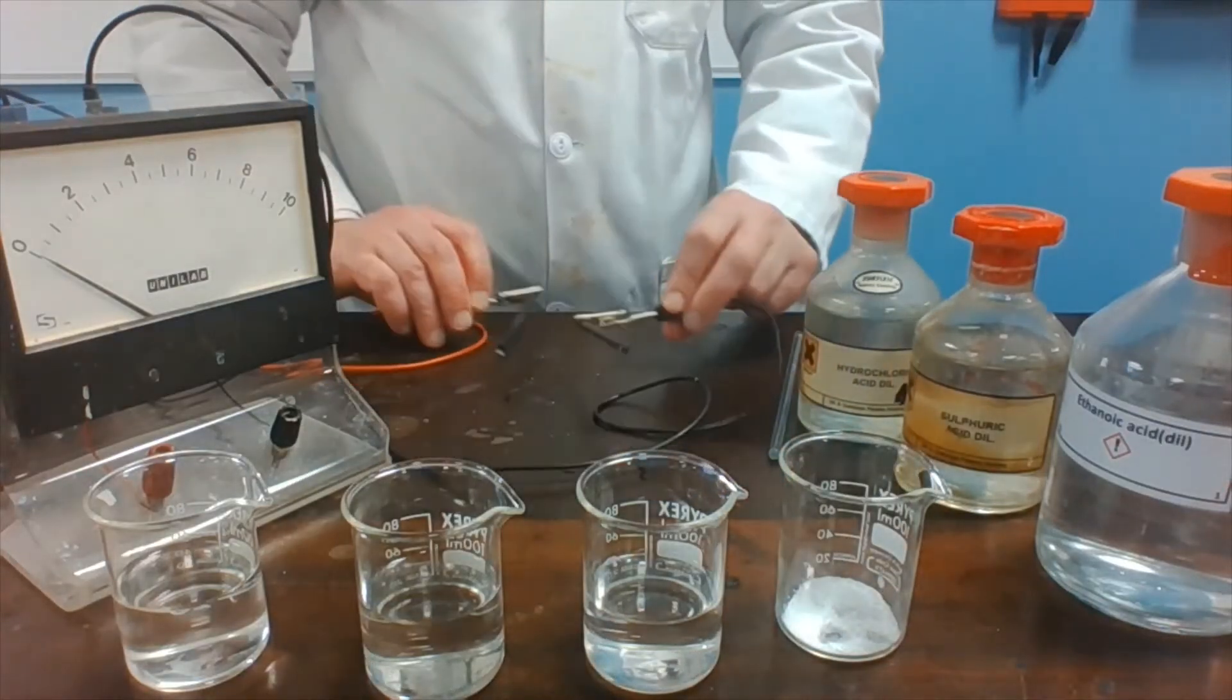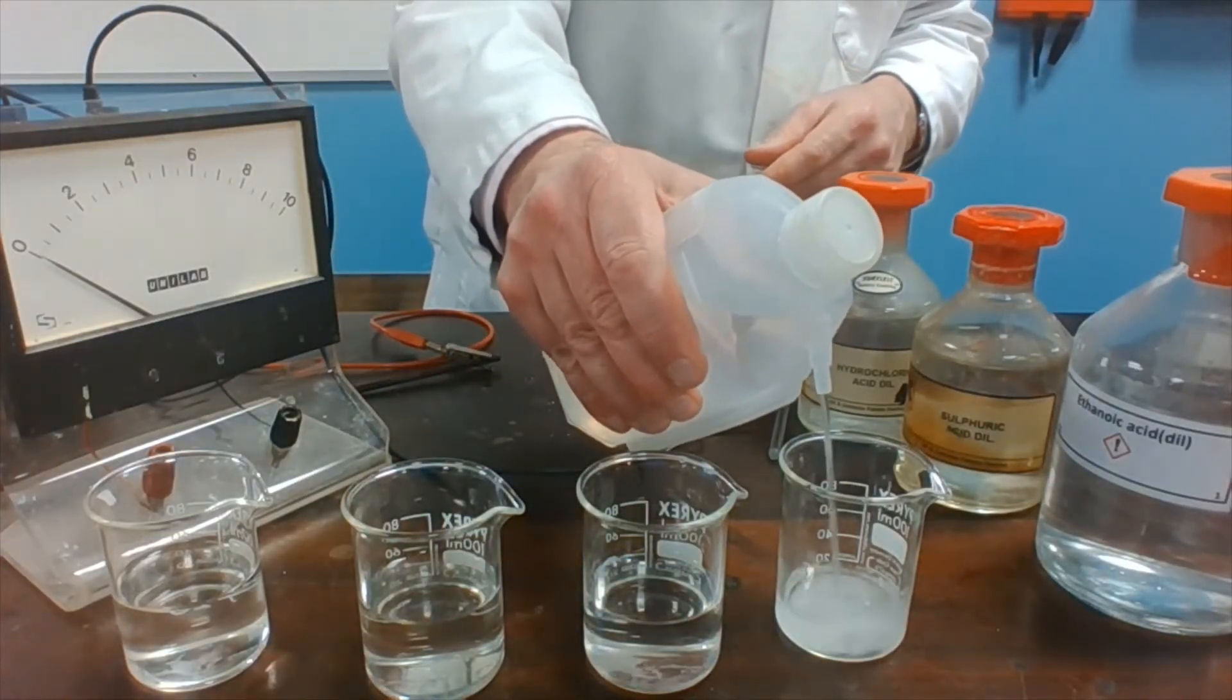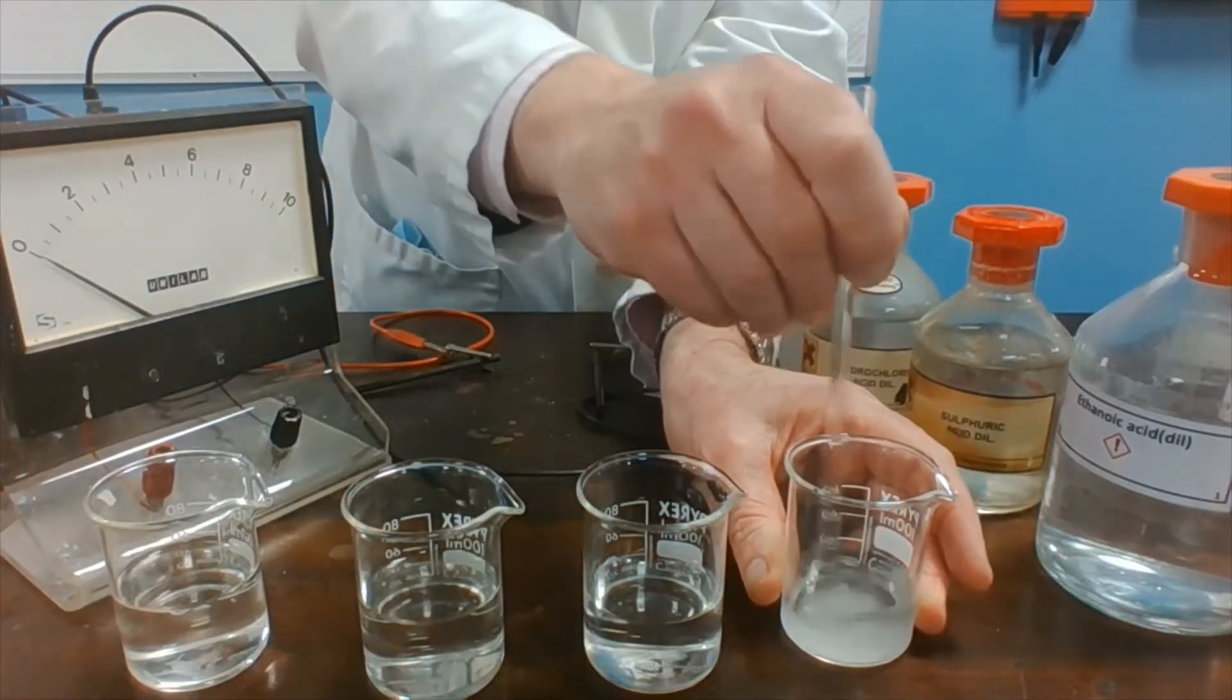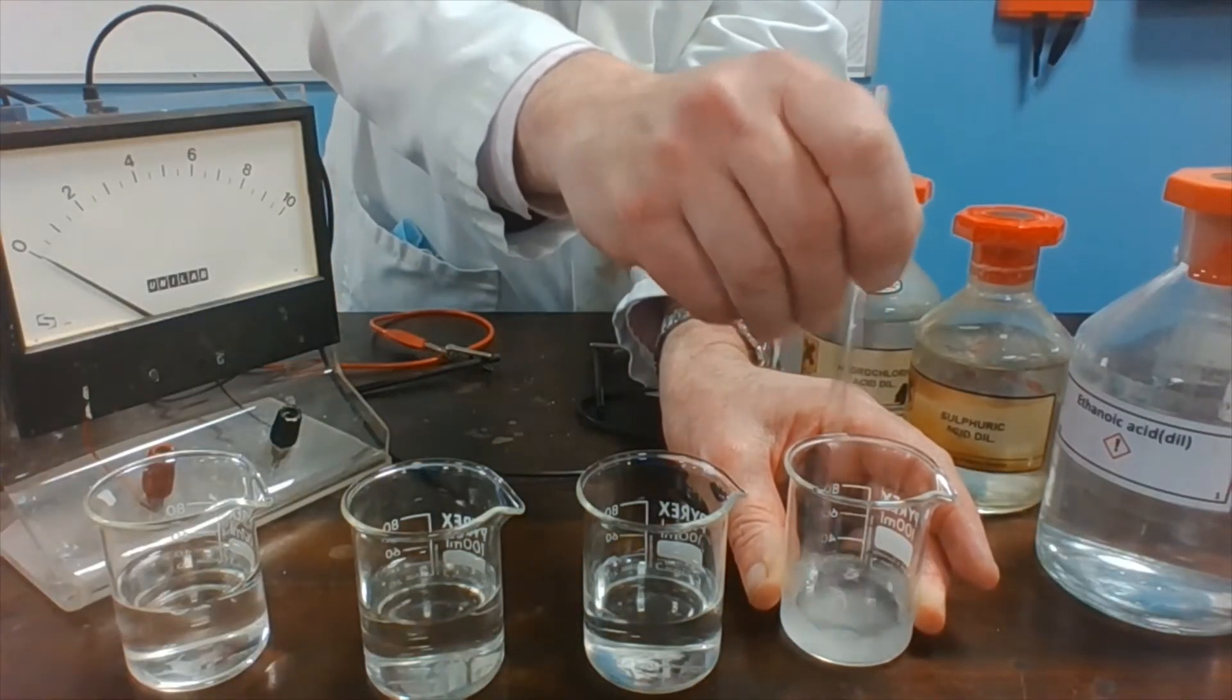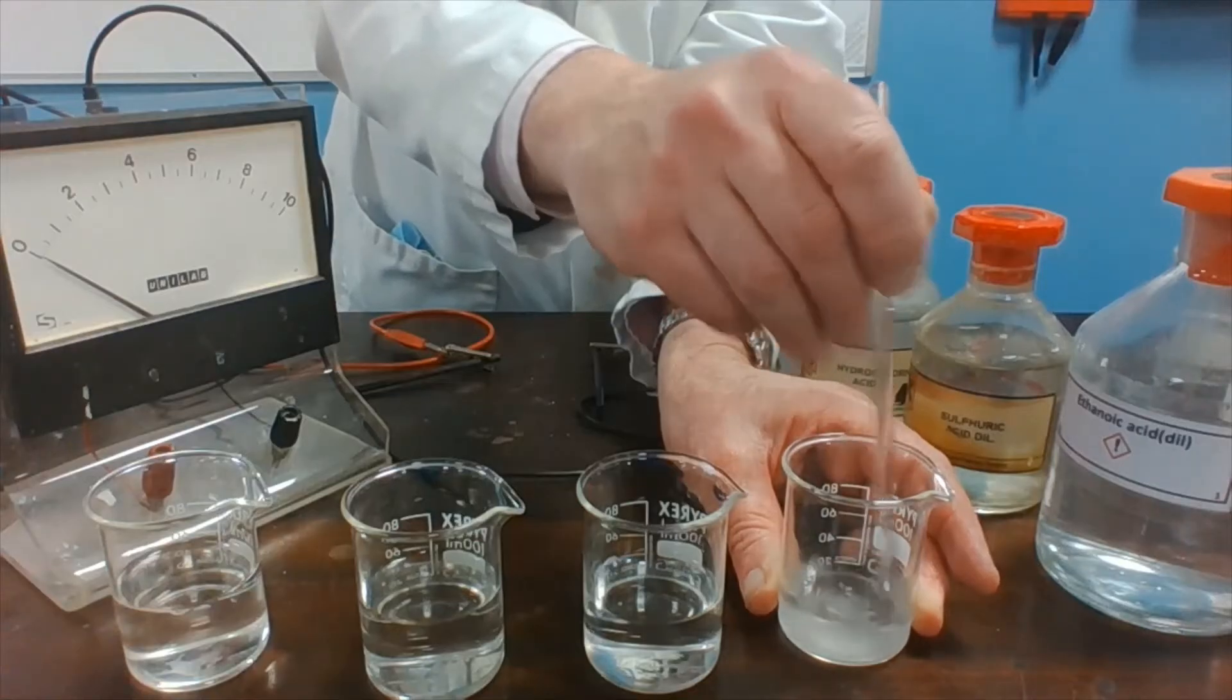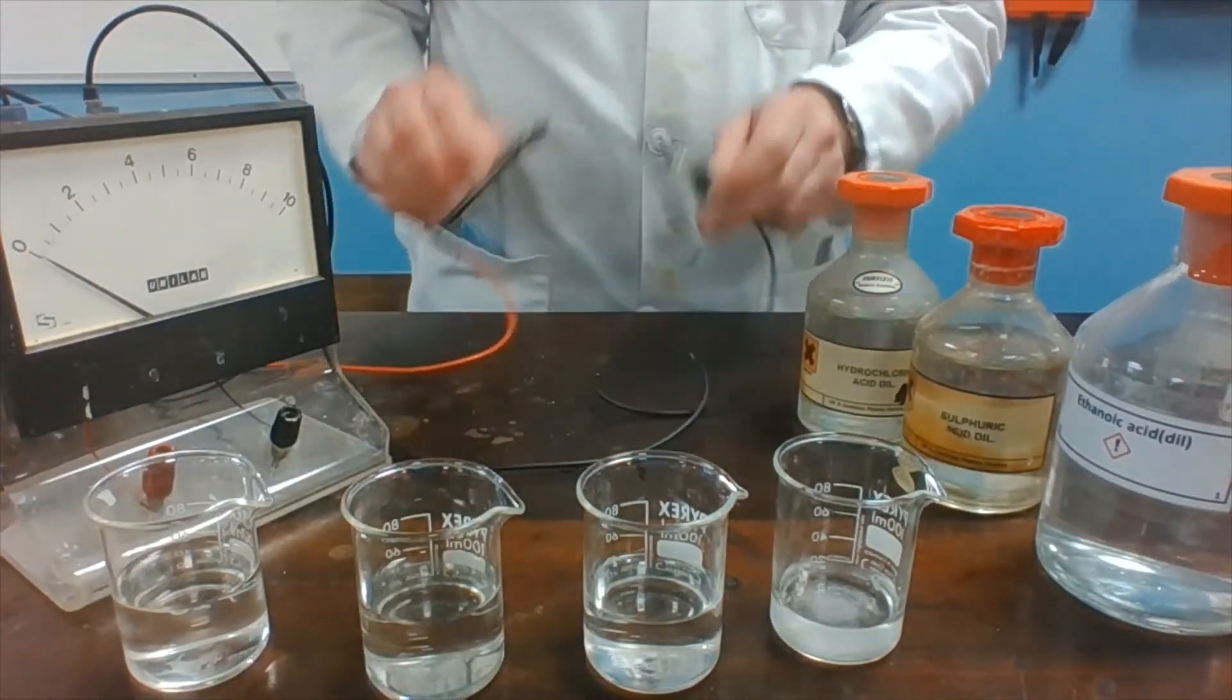If, however, we dissolve the citric acid in some water. And we repeat the experiment.